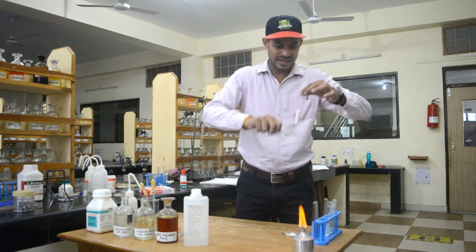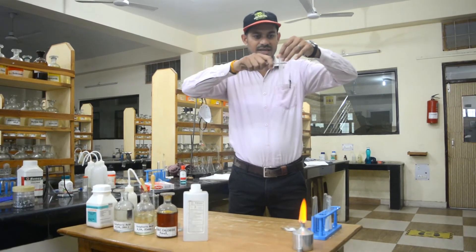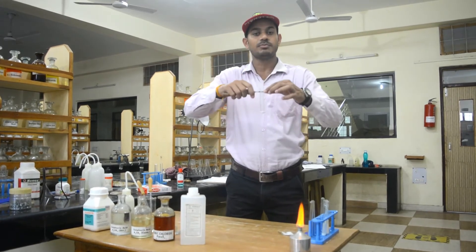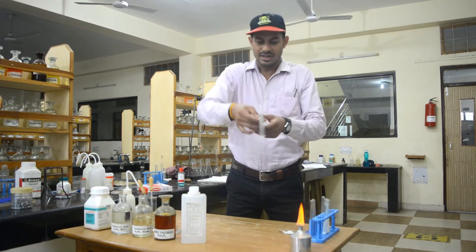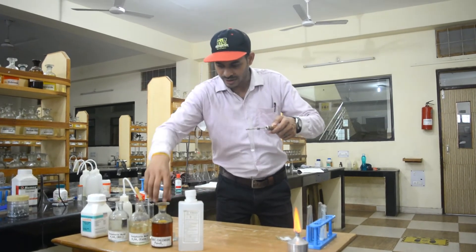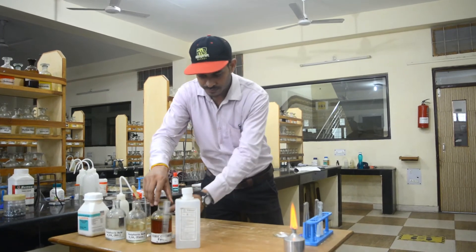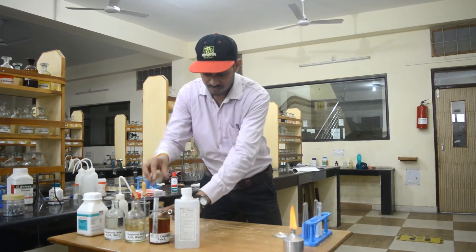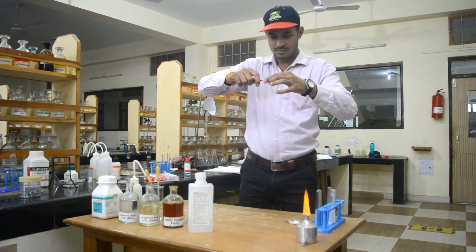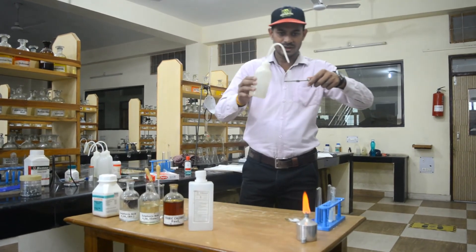Now the next and last test for testing the acetate ion: we will add a ferric chloride solution. This will give a blood red color. I have a ferric chloride solution here, and I will first prepare a salt solution to give a better confirmation.